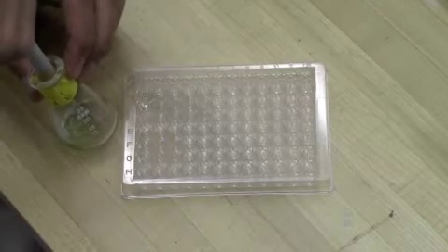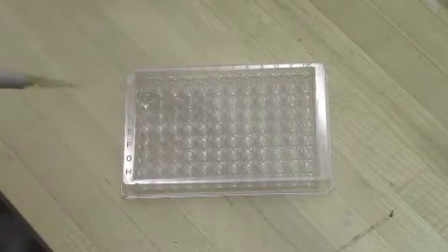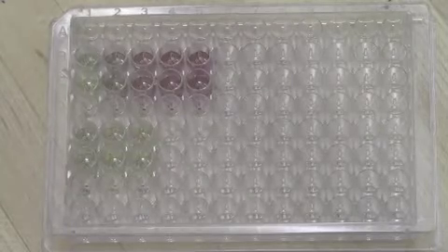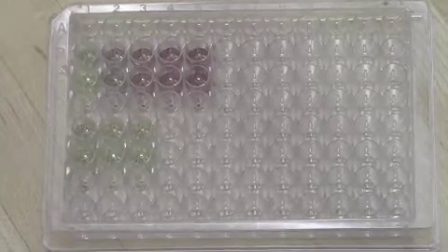Immediately add 200 microliters of the mixture to each well and pipette up and down to mix. You should begin to see a spectrum of color change across the concentration gradient in your wells.